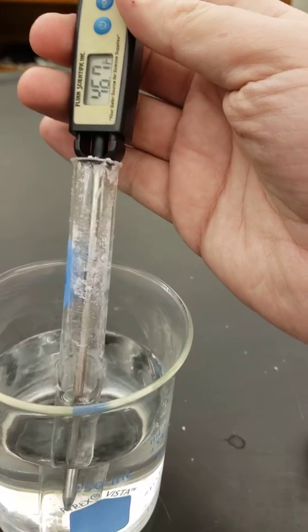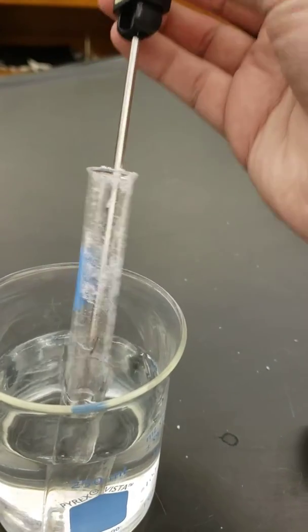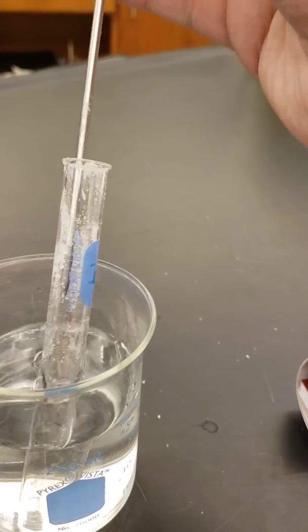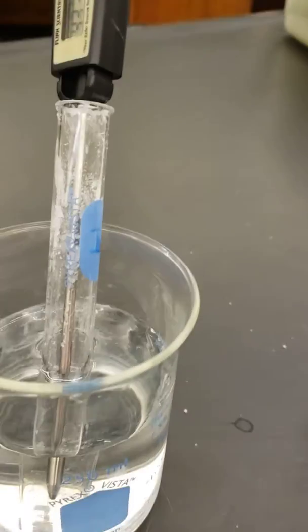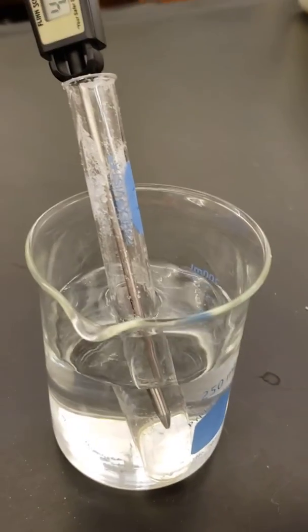Occasionally it'll actually go below the freezing point. One of the ways we can get around this is take some of these crystals up top and move them down in because that'll trigger crystallization instead of getting what we call supercooling.